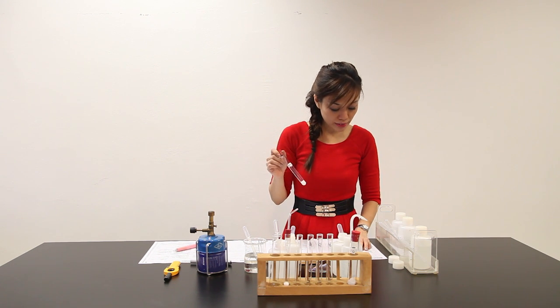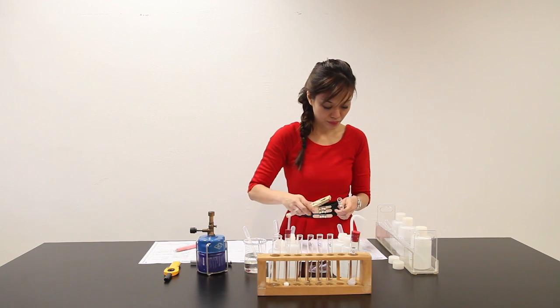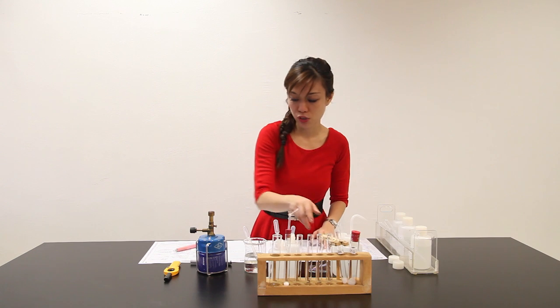Heat this test tube gently at first, and then strongly for about a minute. During this stage, you may observe water droplets being formed at the sides of the test tube. So I'm supposed to heat it gently first, and then strongly.